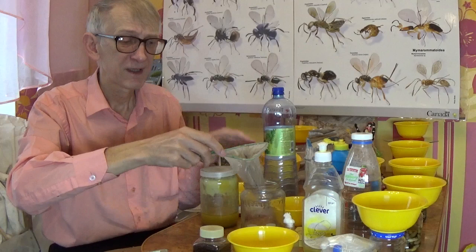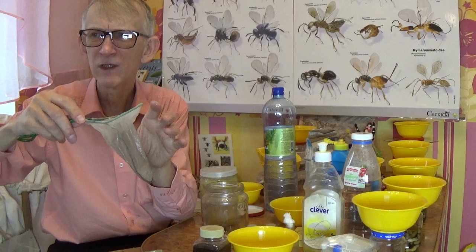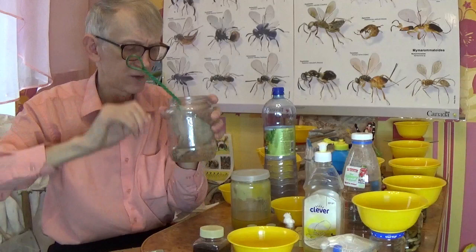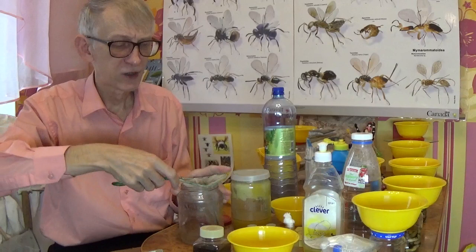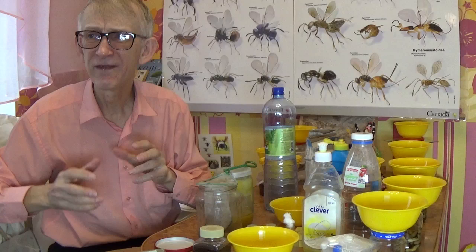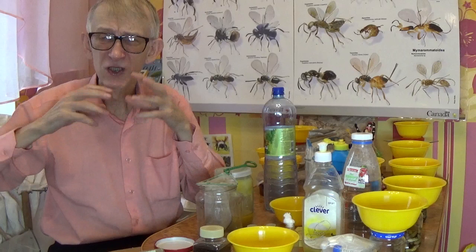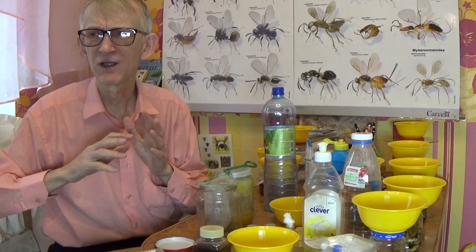You may have collected up to half a net full of insects — quite a lot. Insects are still flexible and won't be destroyed. Bring the net contents to the laboratory in a plastic bag. Your collecting water had salt and shampoo in it, so if you immediately fix this material in alcohol, insects will be covered with a milky surface, which is very difficult to clean later.